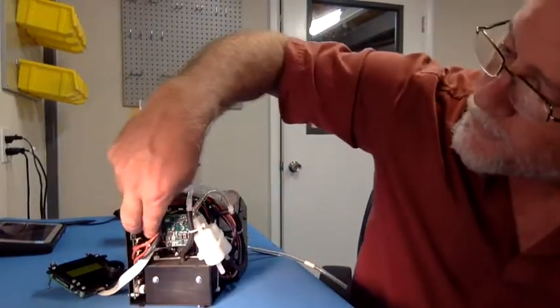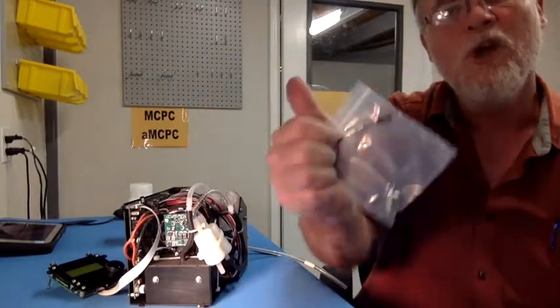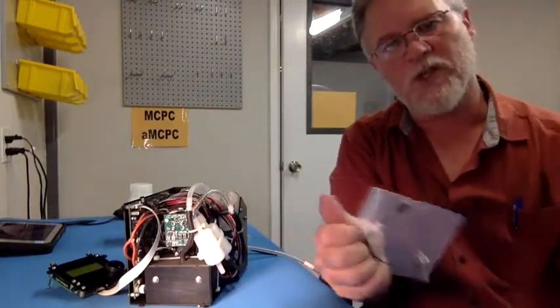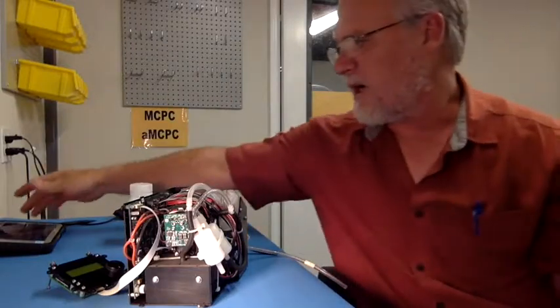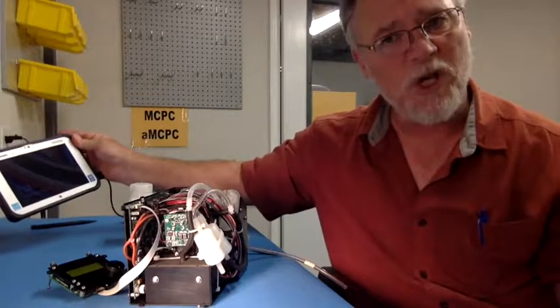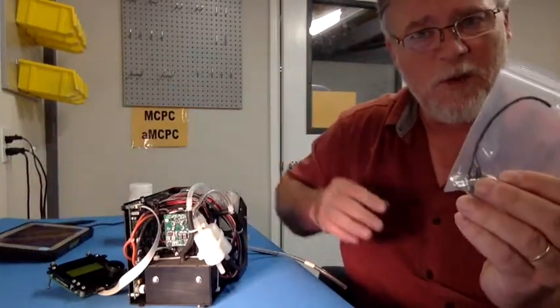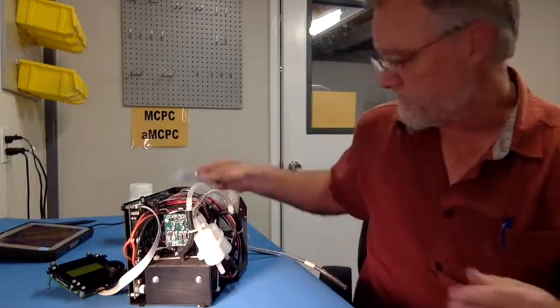Okay? So that's where the serial communication cable would connect only if you want to do serial communication. If you purchase our Access base module, a ruggedized tablet that I can talk about later, then you won't need the serial cable connection. You'll use the USB cable.